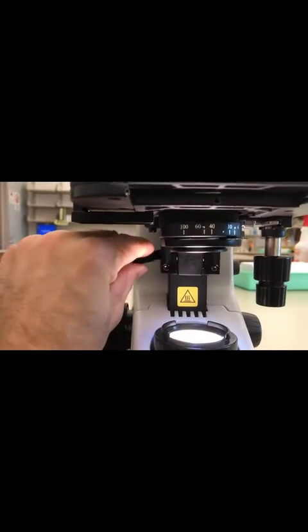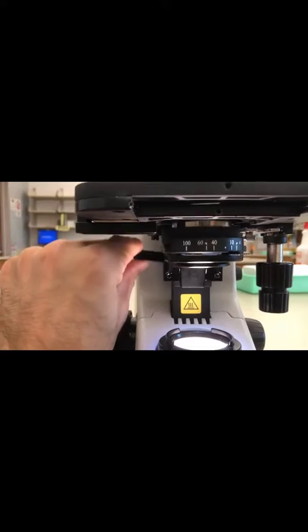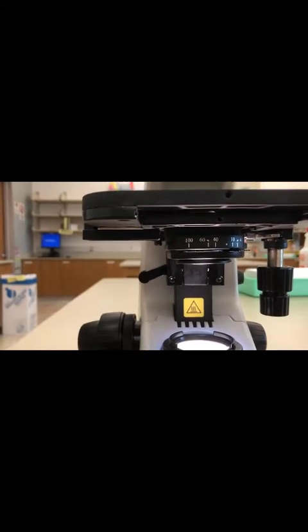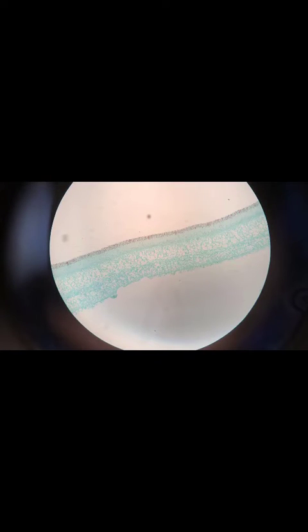This large lens here is the condenser itself. It could be lowered or raised. The condenser focuses a cone of light onto your specimen. Here I'm messing around with the condenser and looking in the microscope, you can see it can turn things gray.